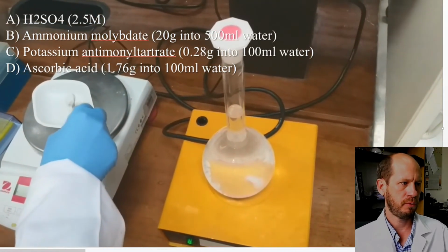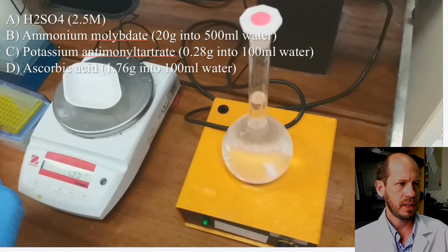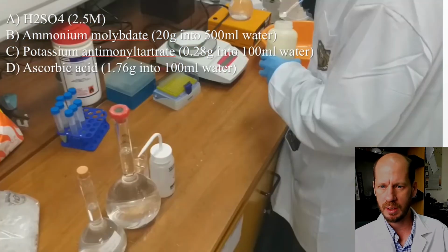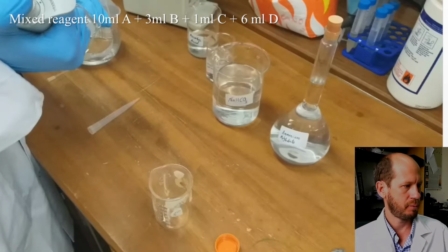So for the moly blue phosphorus, we need to prepare these 4 solutions. There is a sulfuric acid solution, 2.5 molar, ammonium molybdate solution, a potassium antimony tartrate solution, and an ascorbic acid solution. So these 4 solutions we need to make freshly and mix them freshly before we develop color in these samples. This is also showing Lilwa preparing the solutions, which you can go back and see in the previous video on the moly blue measurement.